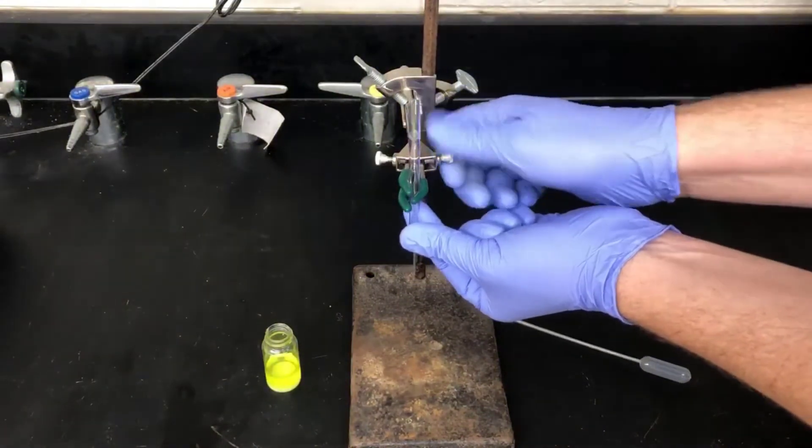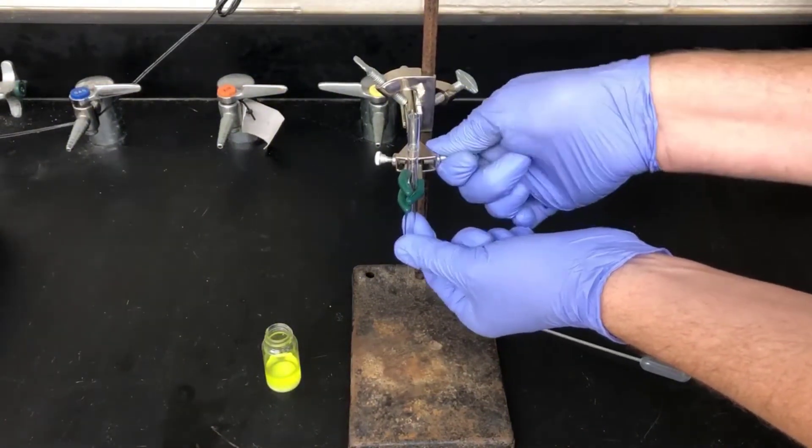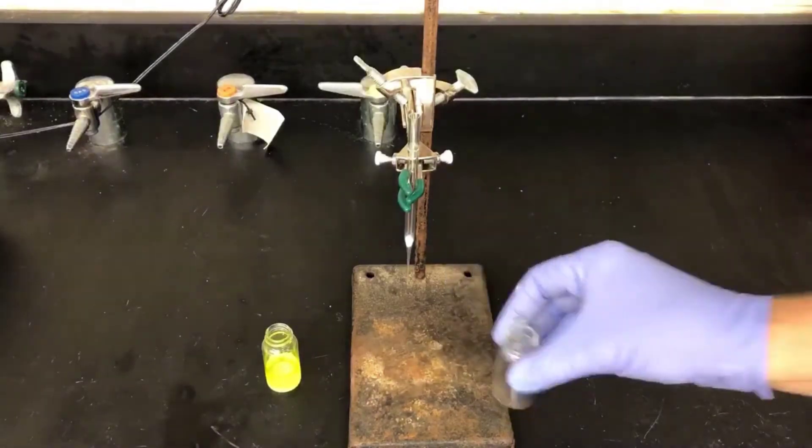I'm going to clamp it here to a ring stand, and then I'll pipette the solution through this into that vial that I weighed in the previous step.